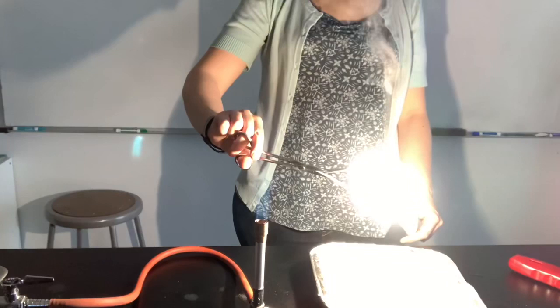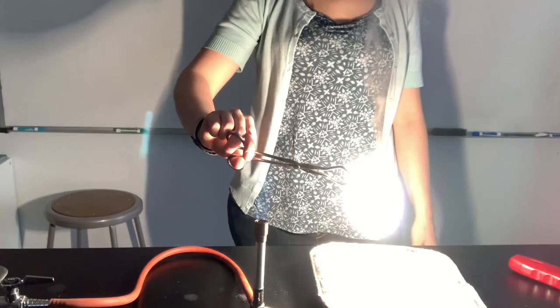Also, my hand is well behind the Bunsen burner, but it kind of looks like it's almost in a flame from this angle. But don't worry, I did use my brain this time.